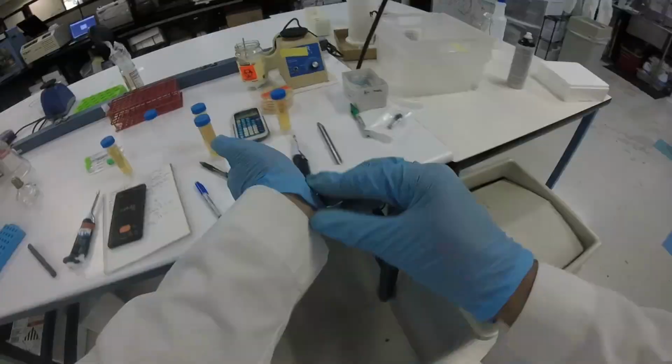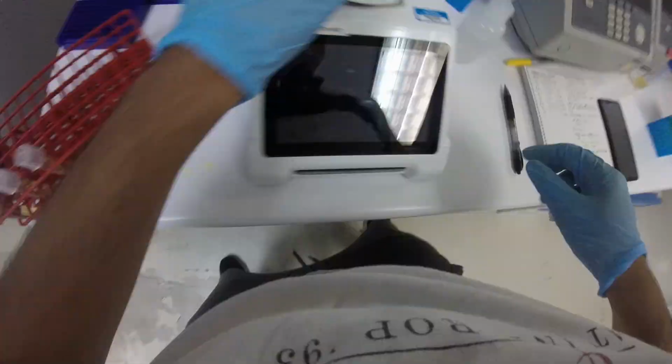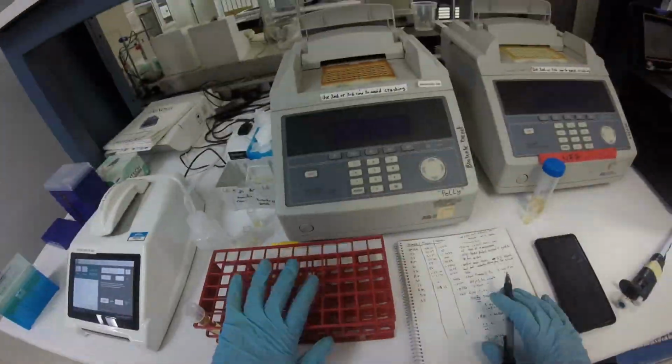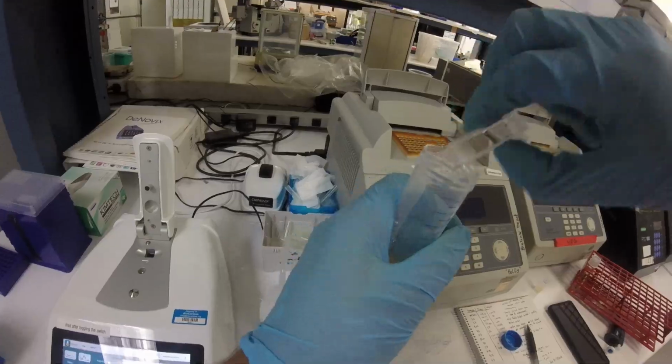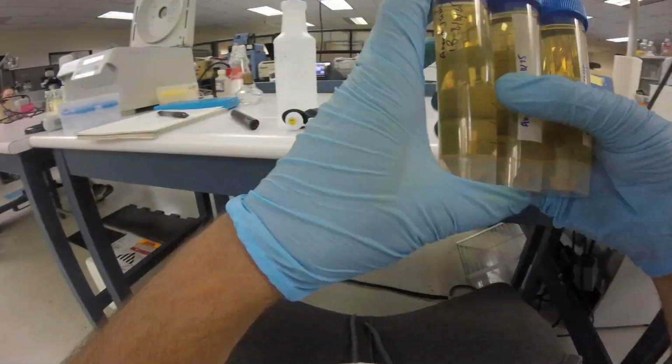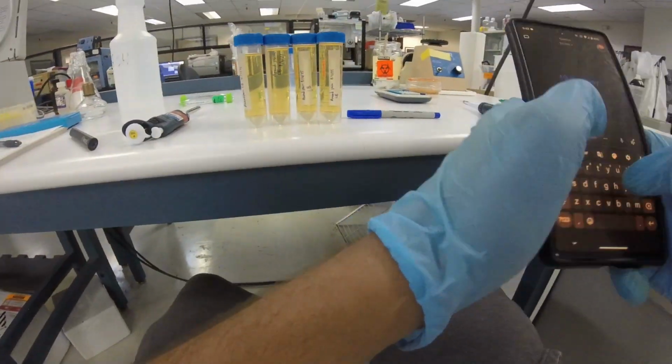Anyways, basically they had some data of, supposedly they had incorporated this beta casein gene into this yeast, and there were these frozen samples. They thawed them, and then we looked at some of the spectrophotometry data to see if there was a noticeable increase or change at a given wavelength to indicate that beta casein was actually being produced. And the data was super inconclusive.